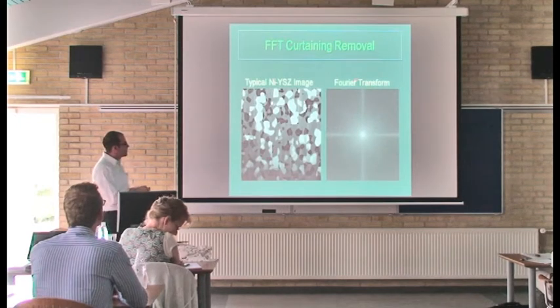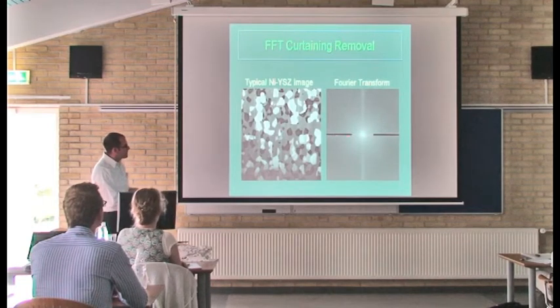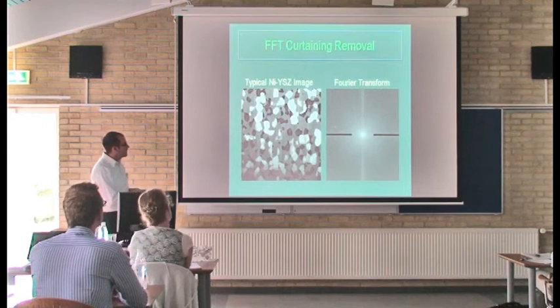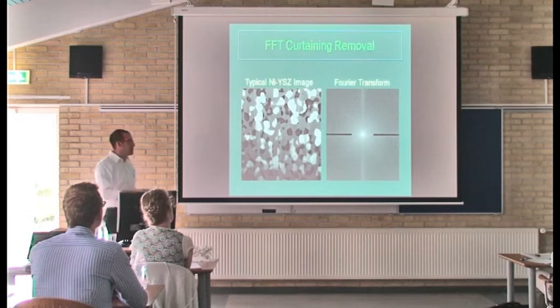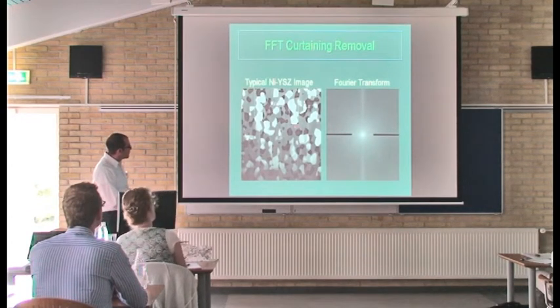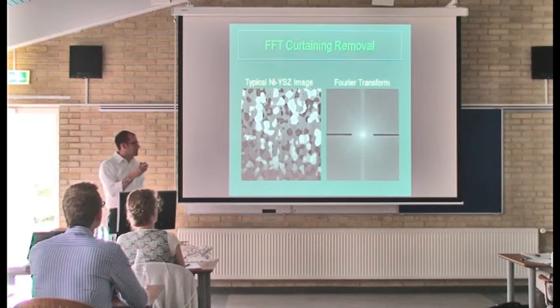And what you can do is take the Fourier transform of this image shown here, and basically block out this horizontal highlighted phase, which corresponds to periodic vertical structures in the image. And I'll kind of go back and forth, and it's a little hard to see, but if you focus on this area, for example, you can see that it kind of evens out those stripings that occur without really affecting any of these interfaces or the structure as a whole.